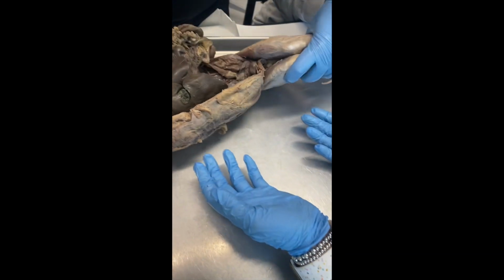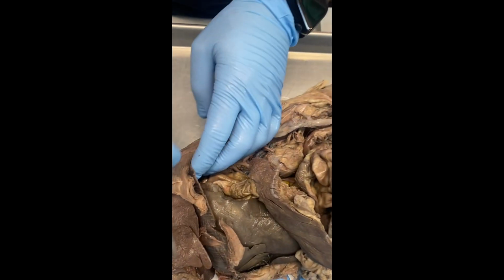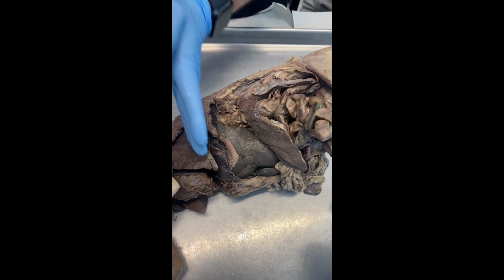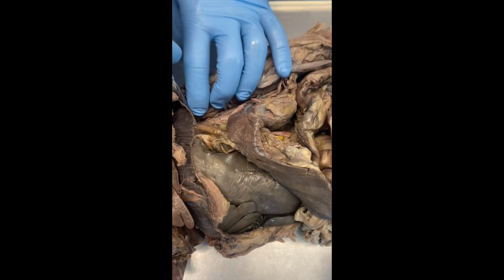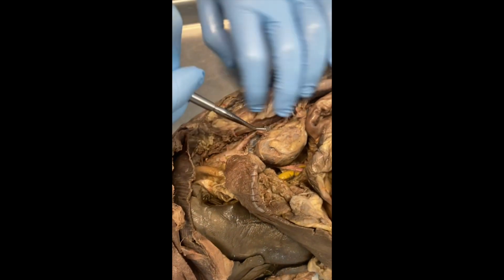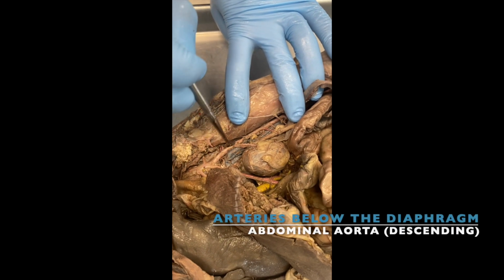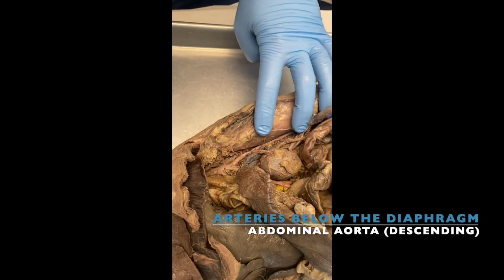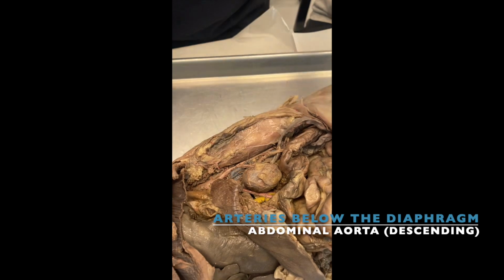Okay, so let's go through them. So you have the aorta leaving the heart. If the aorta is here, then that's thoracic aorta. But if the aorta passes the diaphragm and enters the abdominal cavity, guess what's the name of that aorta now? Abdominal aorta, or also descending aorta. Okay? The abdominal aorta has some branches.